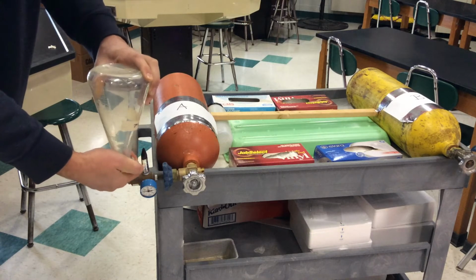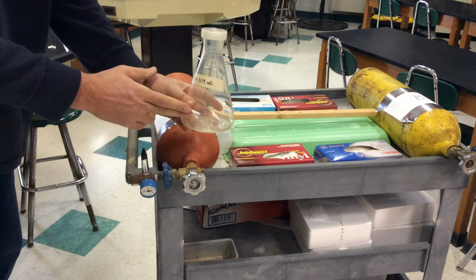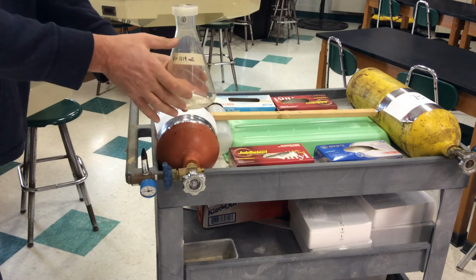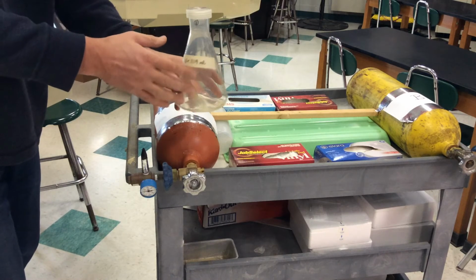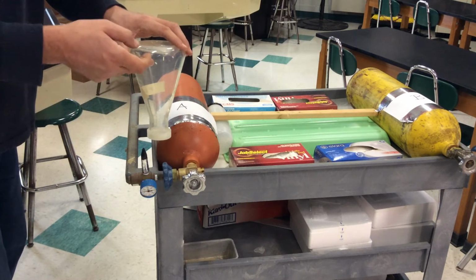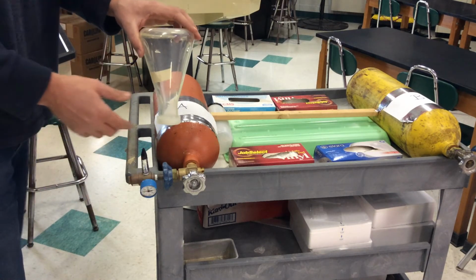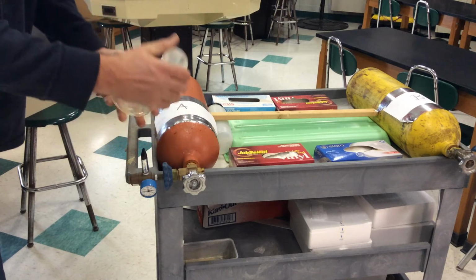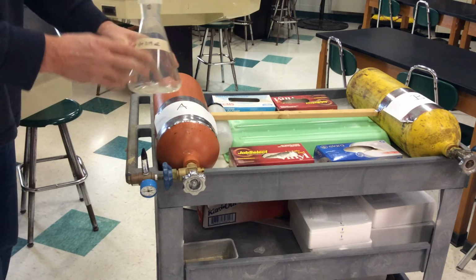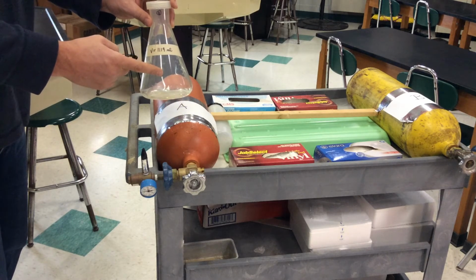And now, once it's tight, I can turn it upright, and now I can mass this flask that has gas A in it, totally gas A. We're going to assume that we flushed out all the air as the gas came in, went up this way, and displaced the air. If we wait long enough, about 15 seconds or so, that's a good estimate. Take this now and mass this on the scale. The scale will be on lab table 1, and just mass this out, and now you have the mass of A and, of course, this flask.